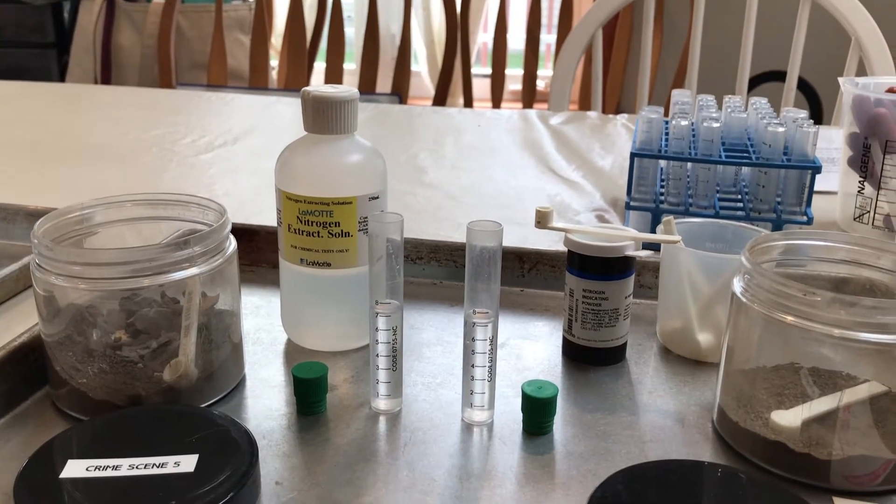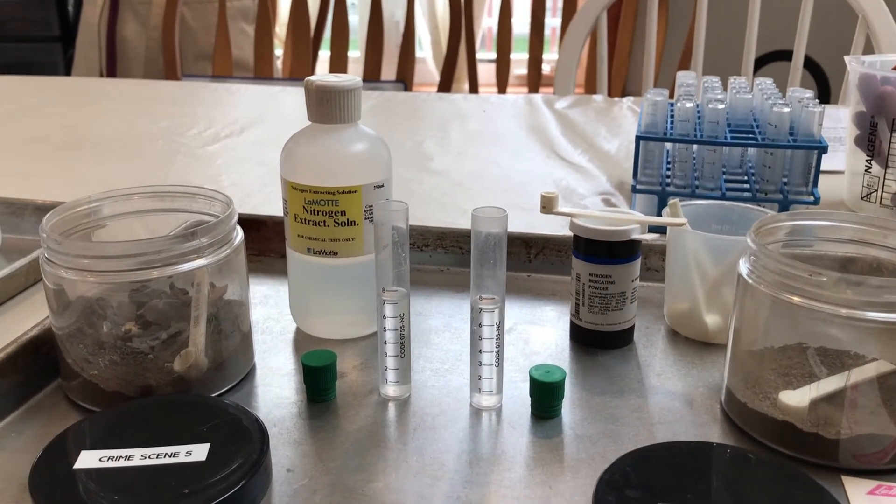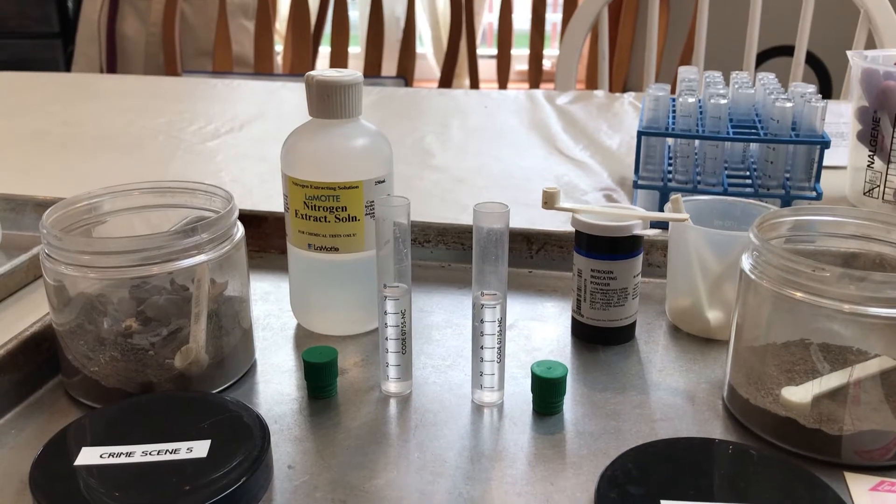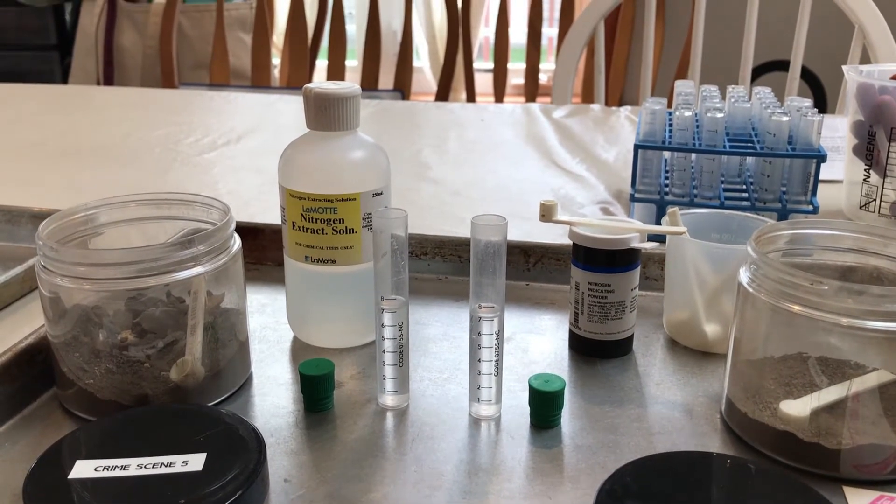Okay ladies and gents, now we're going to do the nitrogen test. We're gonna look for nitrates in the soil using nitrogen extraction solution.